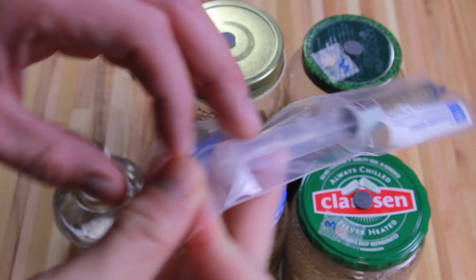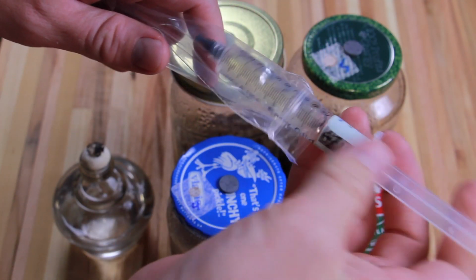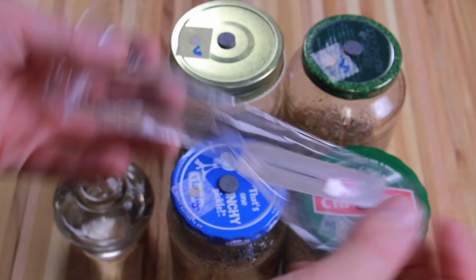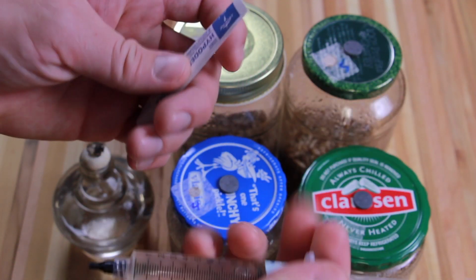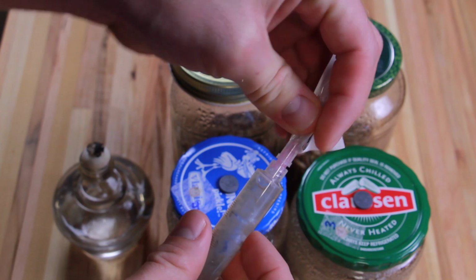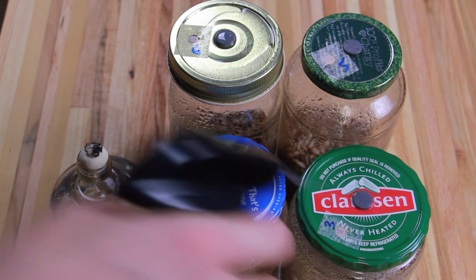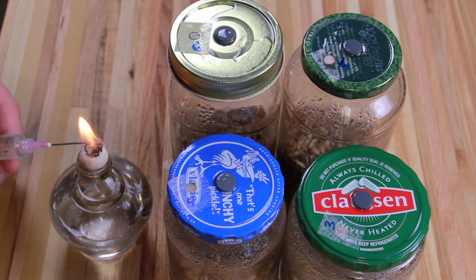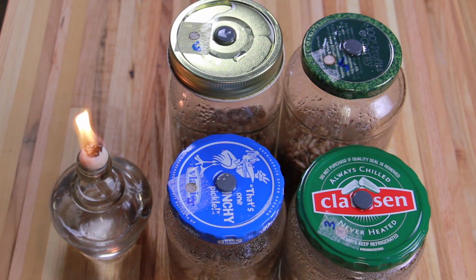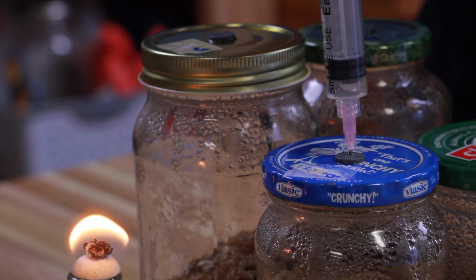Alright, so now this is the next day, and I've let all 4 of these jars cool down. I have a syringe here of liquid culture, and this is king oyster. I think elsewhere in this video I might have called it blue oyster, but this is a king oyster liquid culture, which is just mycelium that's suspended in a syringe full of water. I start out by shooting a little bit of rubbing alcohol onto the injection ports here, and then I heat the needle up until it glows red, shoot a little bit of the liquid culture out to cool the needle, and then I injected about 3 cc's into each of these jars.